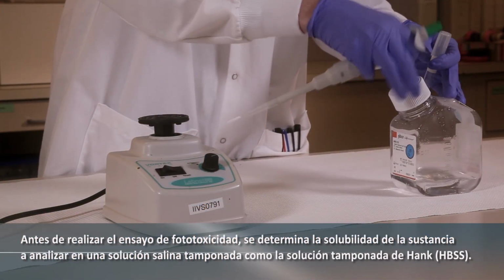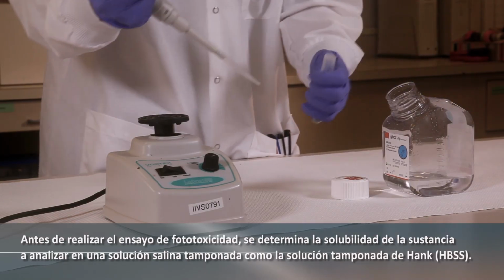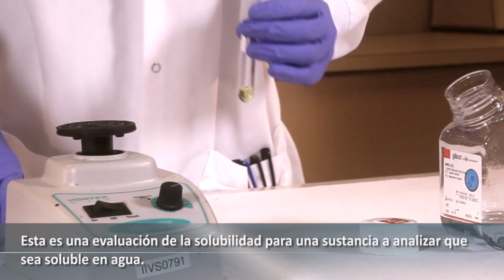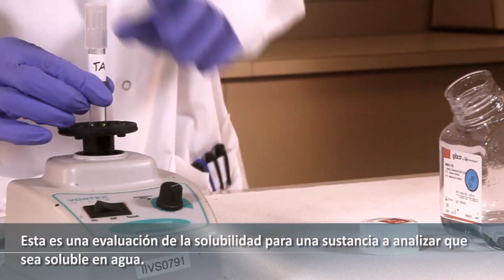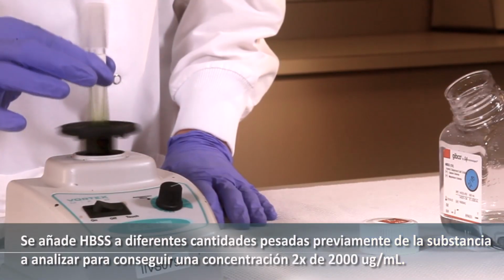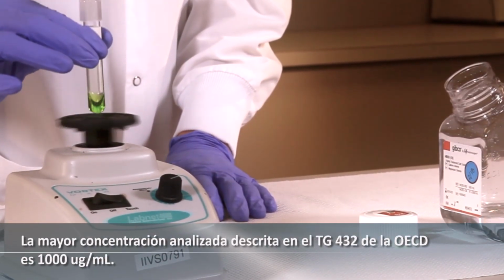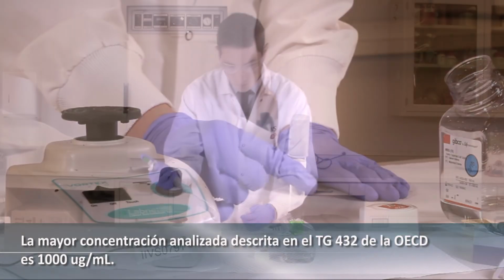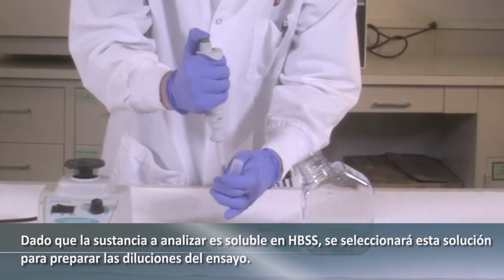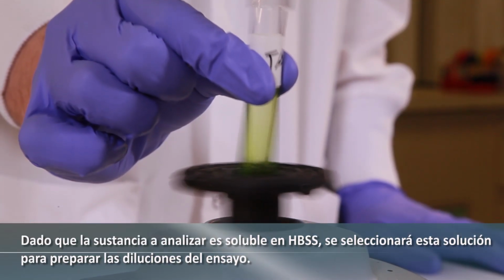Prior to testing in the phototoxicity assay, the solubility of the test substance is first assessed in a buffered salt solution, such as Hanks balanced salt solution, HBSS. This is a solubility assessment for a test substance that is aqueous soluble. HBSS is added to pre-weighed test substances to achieve a 2x dosing concentration of 2,000 micrograms per milliliter. The highest tested concentration, as outlined in OECD Test Guideline 432, is 1,000 micrograms per milliliter. Since the test substance is soluble in HBSS, it will be selected to prepare the test substance dilutions.